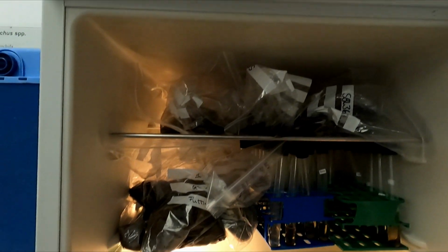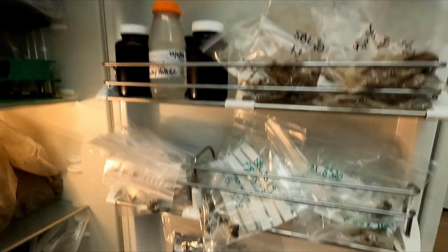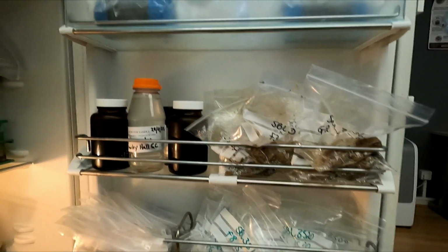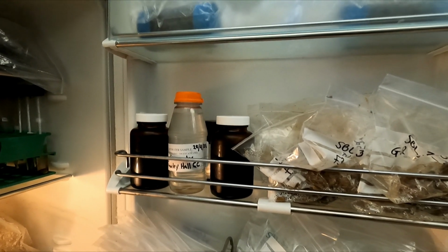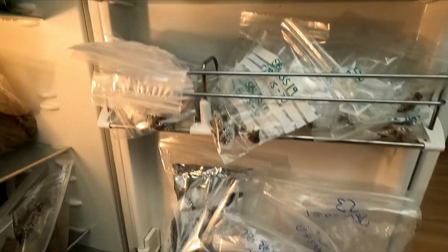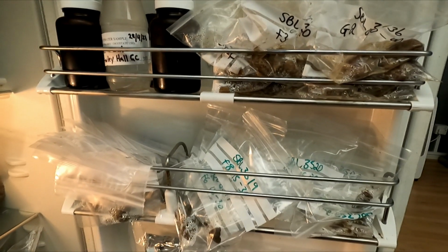So the first thing to reiterate is whatever samples you collect, wherever you send them for whatever analyses, make sure that you label them carefully. That is usually the date, the field, garden, plot, area identification, and if possible, actually put your own name on it as well.